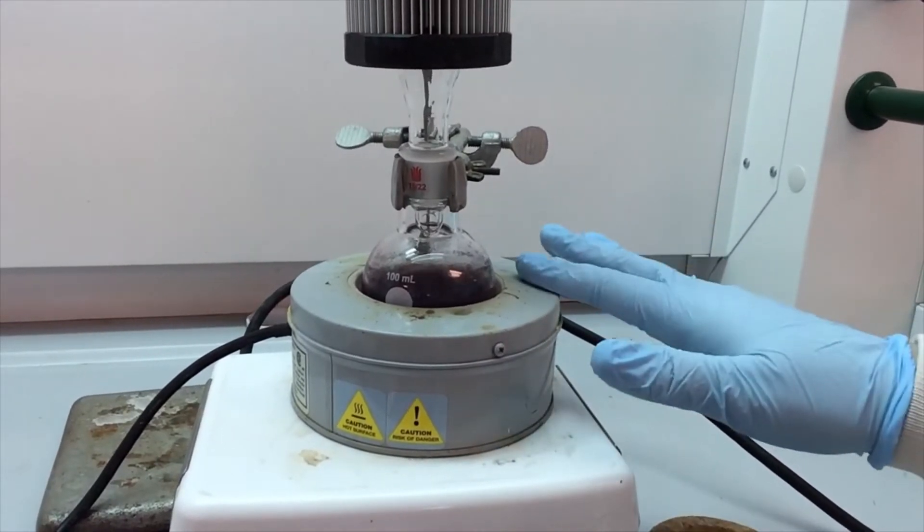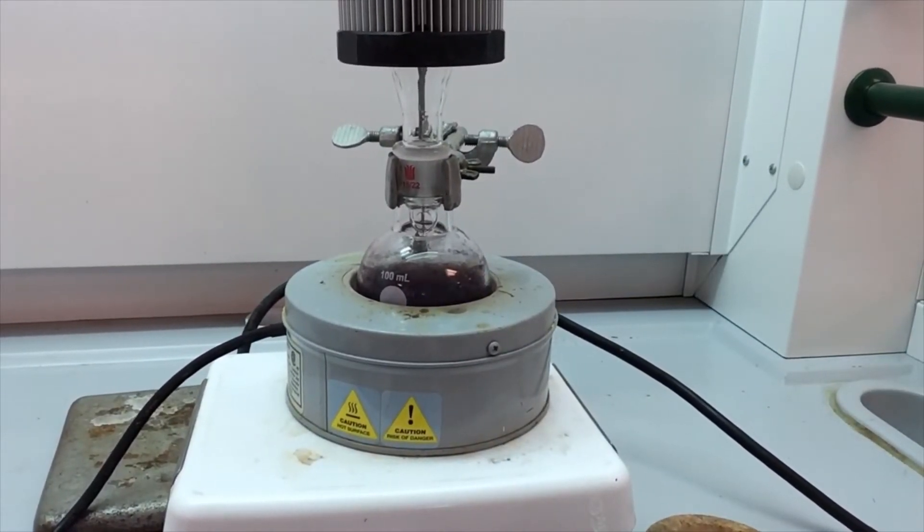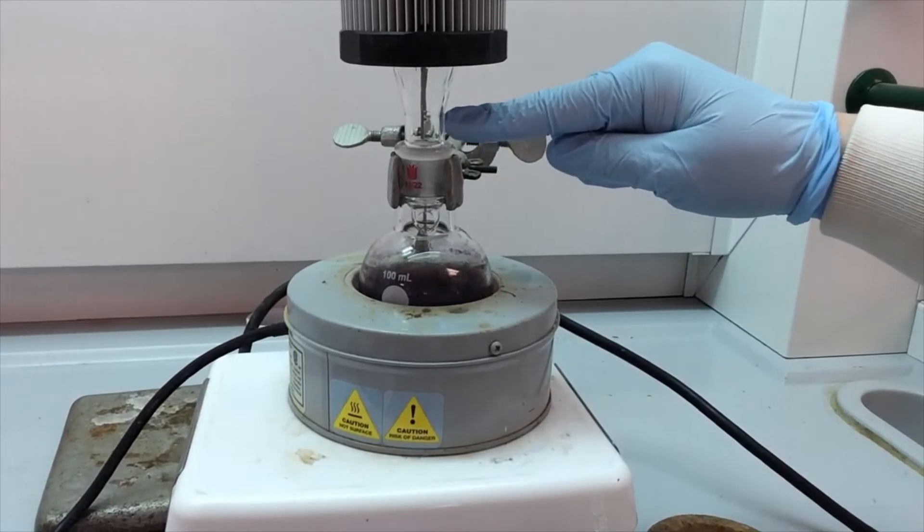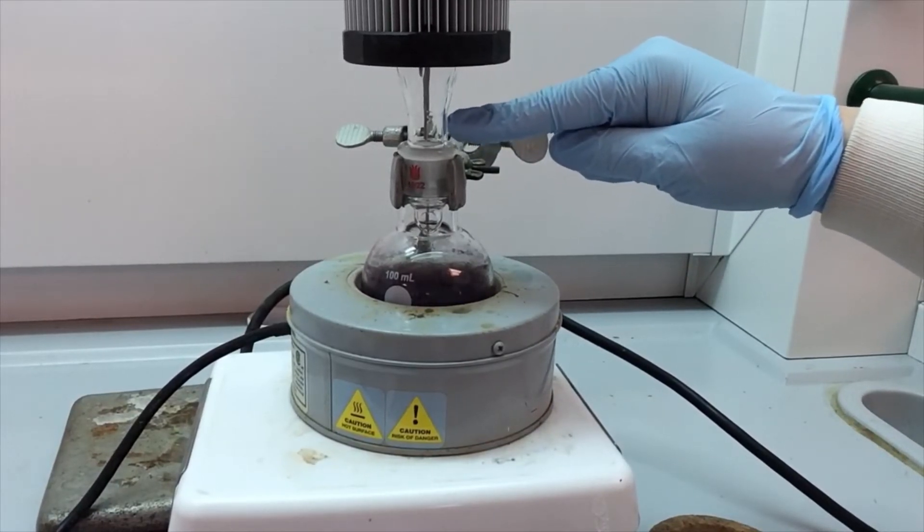So this is hot enough to get our acetone boiling. That's the solvent I'm using. We have our little wavy reflux line up here where my finger is.